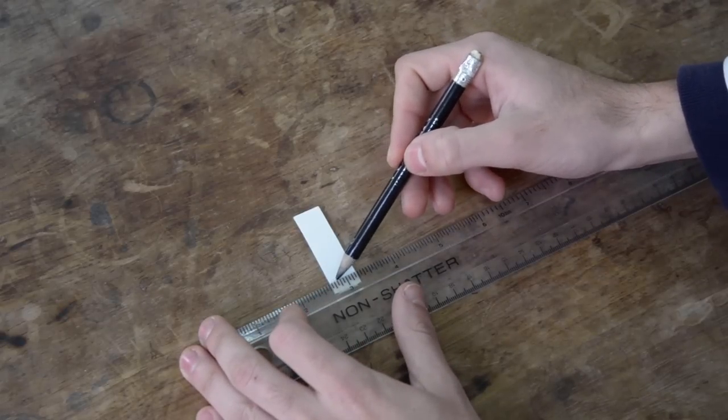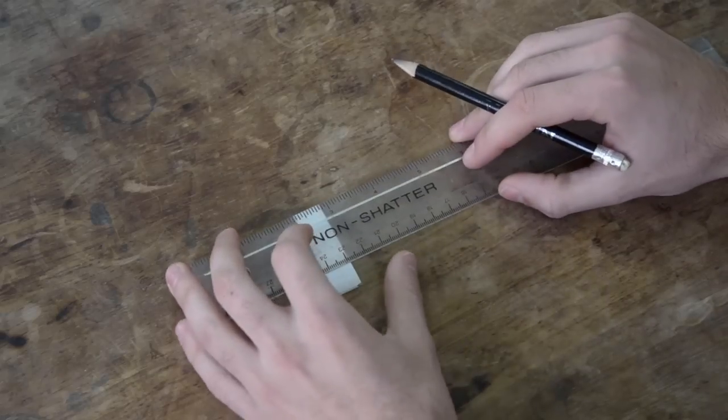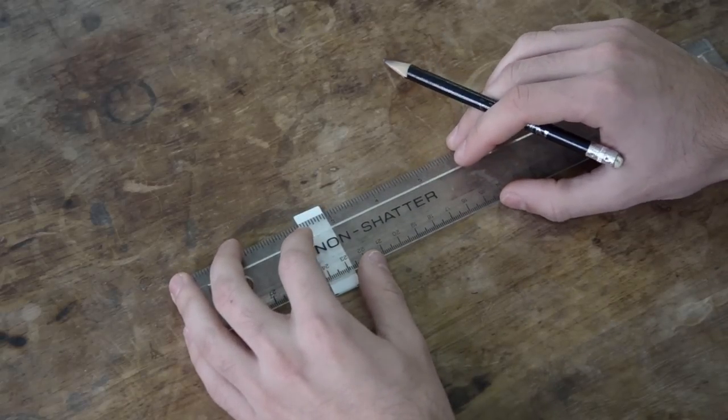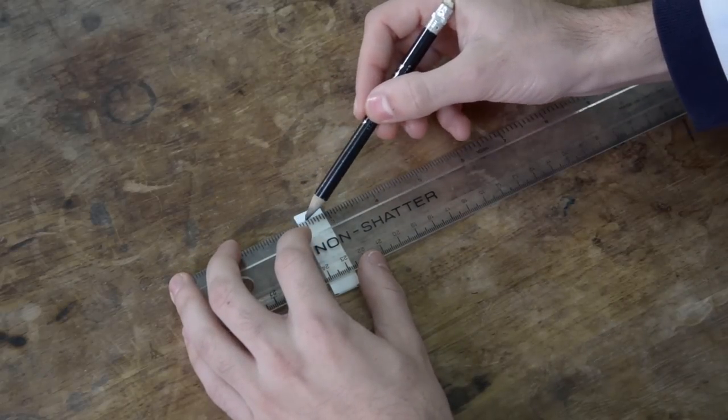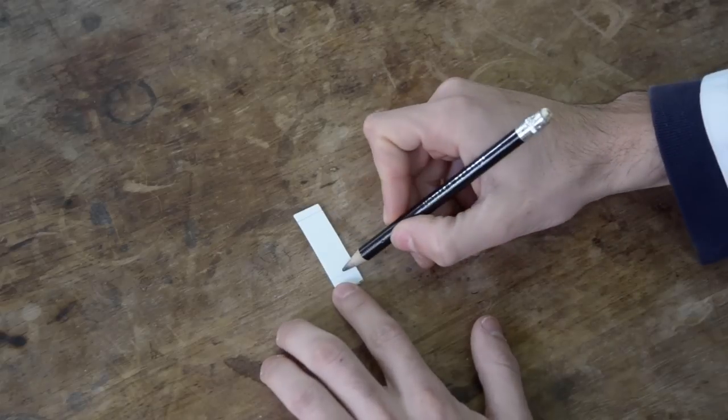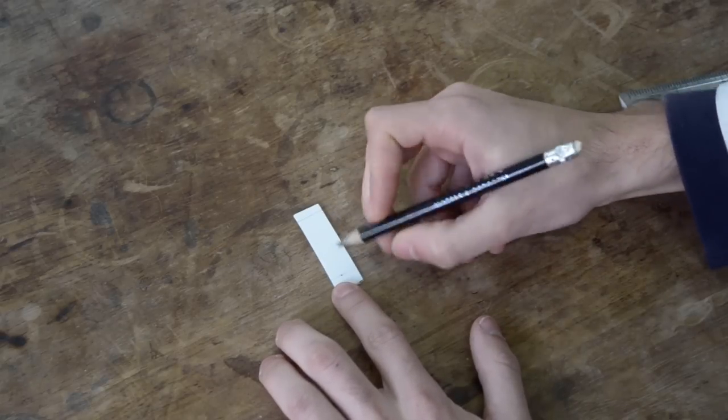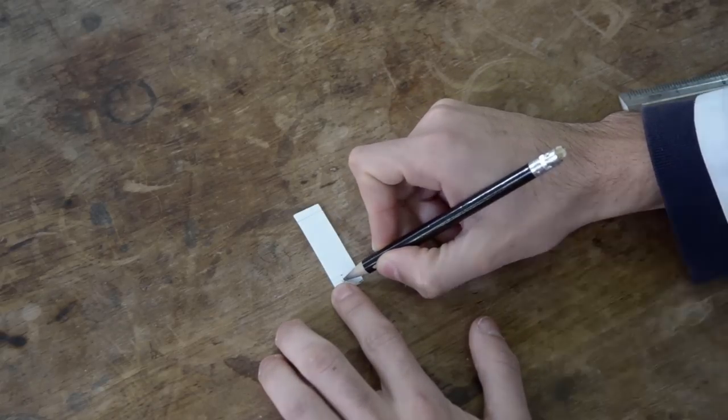Draw a line 1.5 cm from the bottom and another line around 0.5 to 1 cm from the top using a blunt pencil. Mark a spot on the bottom start line and label it accordingly.